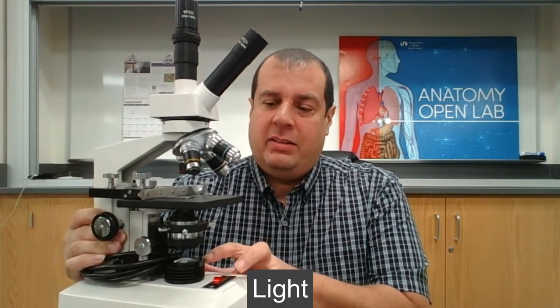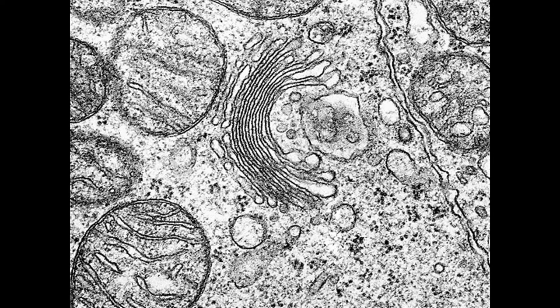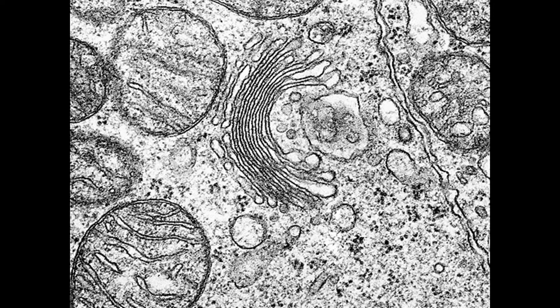As a student of Anatomy and Physiology, you're going to be studying cells, tissues, and organs, and this is the structure you want to use. Basically, there's a light down here that goes through and up to the stage where the specimen is located, and then you have a visual of a cell. You can see organelles and definitely the cell, though you won't get as far down as seeing electrons and protons.